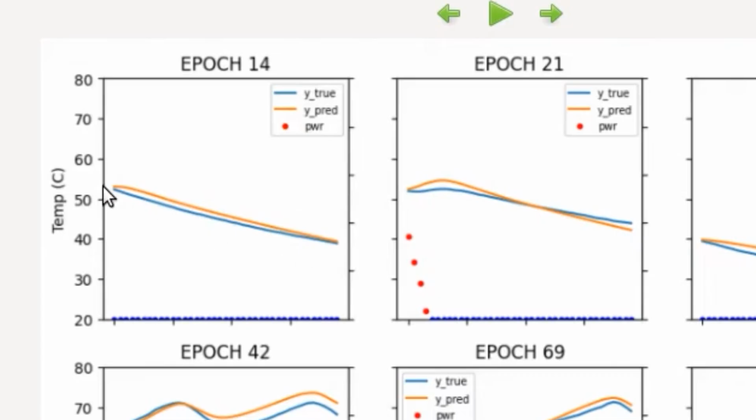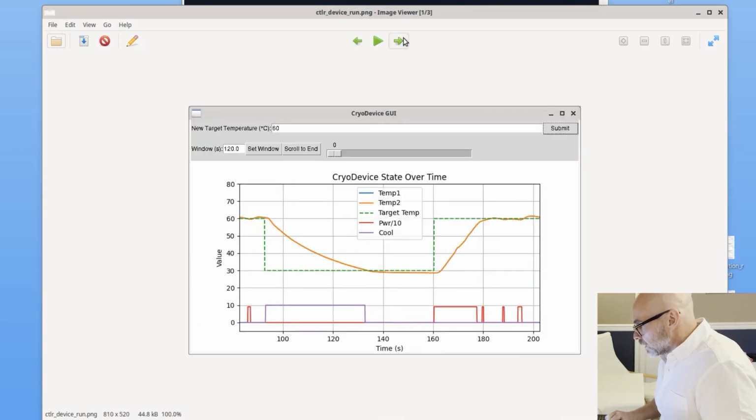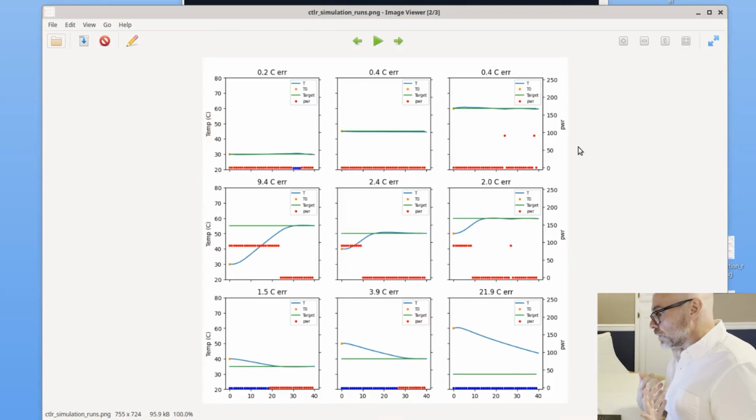So starting from that point and then not seeing any of the other true values, but just seeing the control inputs, how can this trained simulator perform? So that was really good. Got that to be sufficiently accurate. There's a lot more bells and whistles I could add, but I needed to move on. We'll get to that. Okay, and then I went and trained a controller on that simulator, so to actually control the temperature to a desired temperature.